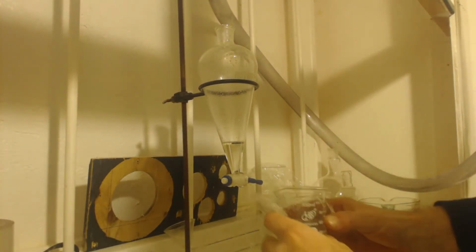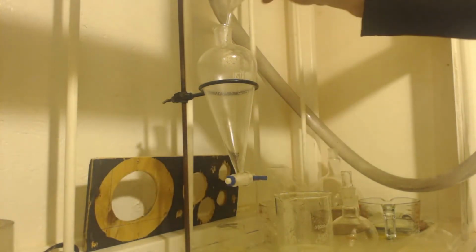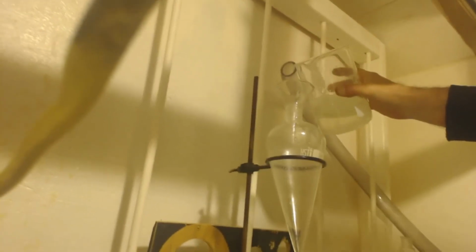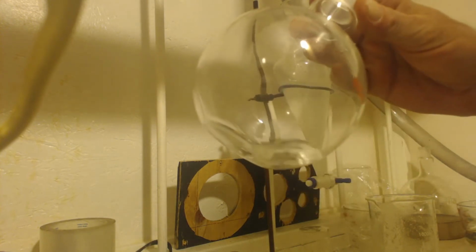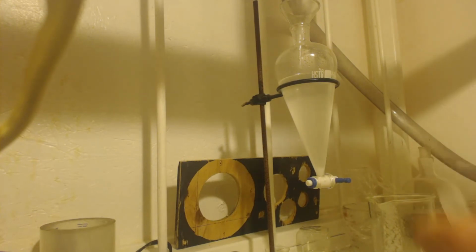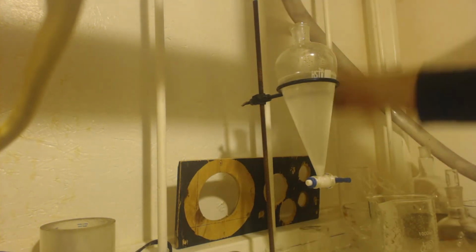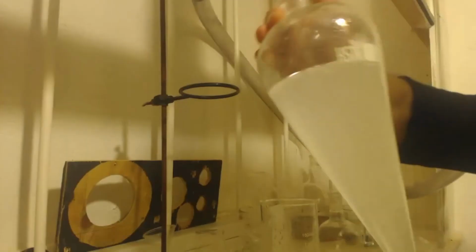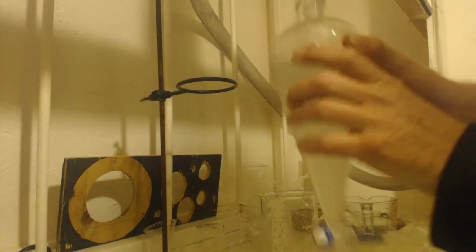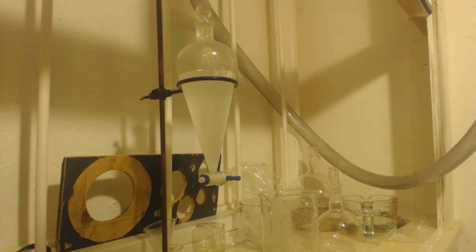Now, top layer is our ether, so we're going to put it with our stock batch here. And we're going to put our water layer back in. And the last of the ether, I don't know how much that is, probably like 20 milliliters, close to it. Shake it, make sure to vent. Alright, now I'm going to let it sit there again for another, actually I've been watching half-hour programs in between this, so I've been leaving these sit for a half hour.